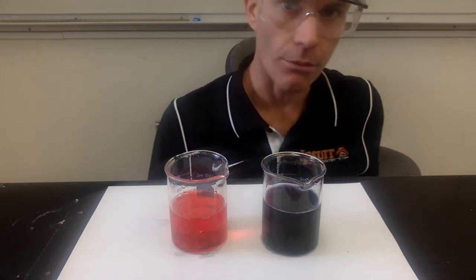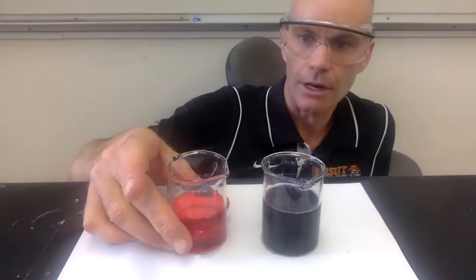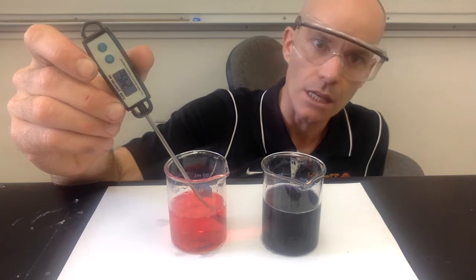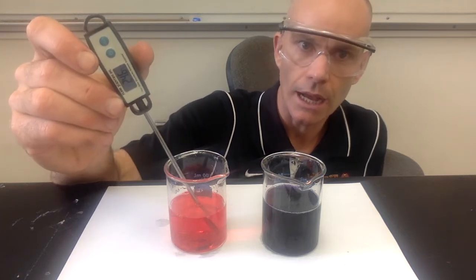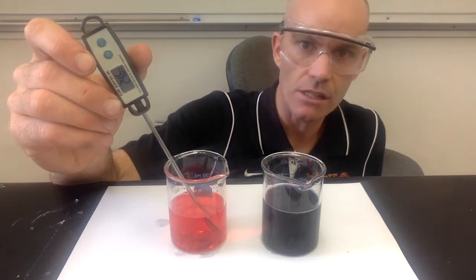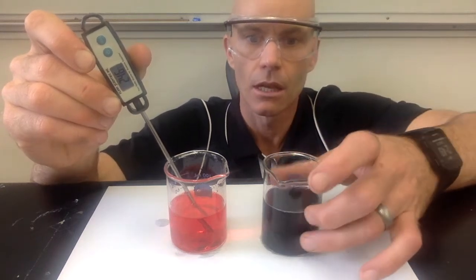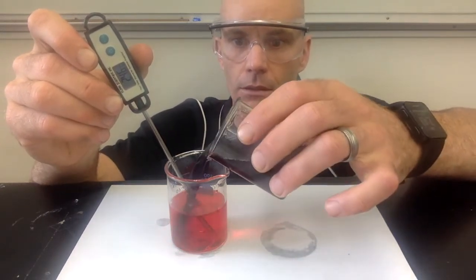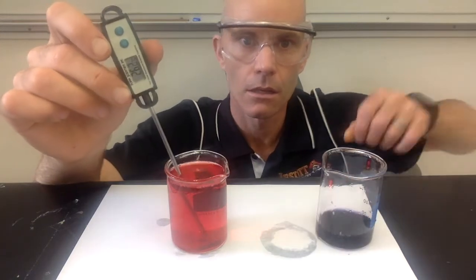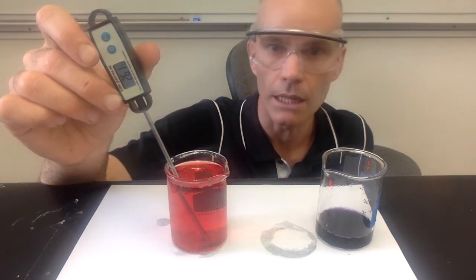So that's investigation 3. And then investigation 4, we're going to pour these 2 together. I'm going to use a thermometer to measure the temperature. And so we can measure the temperature of this solution right now, which is 24.6. In the instructions it says to feel it, but since you can't feel it, I'm using the thermometer to help you see any temperature changes. And so we're going to be adding this one. And you can make your observations. And we can observe the temperature is now 26.1.